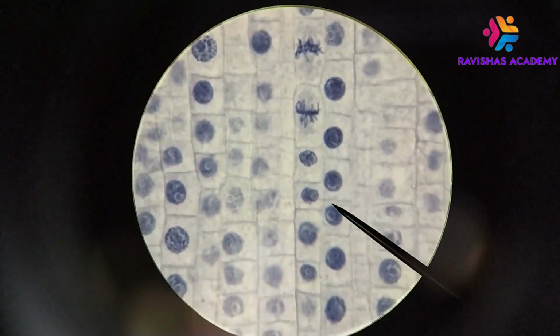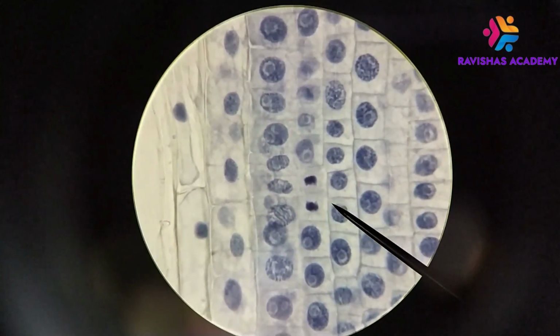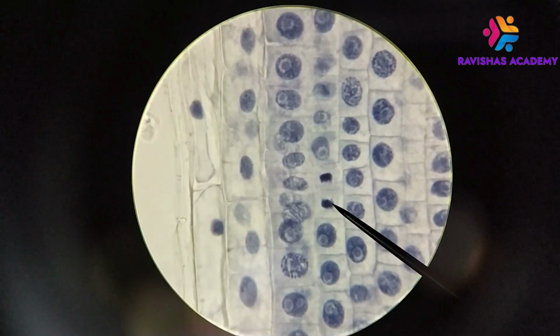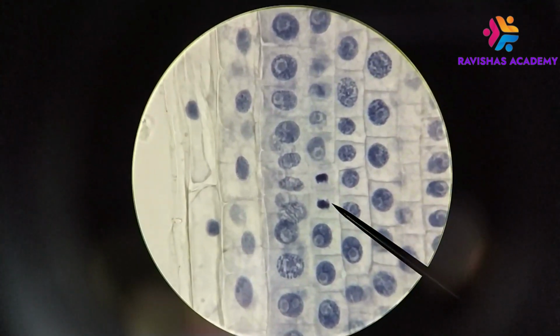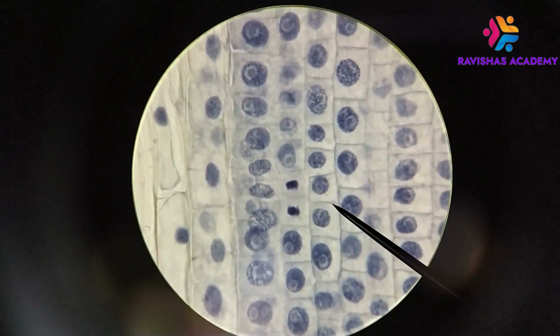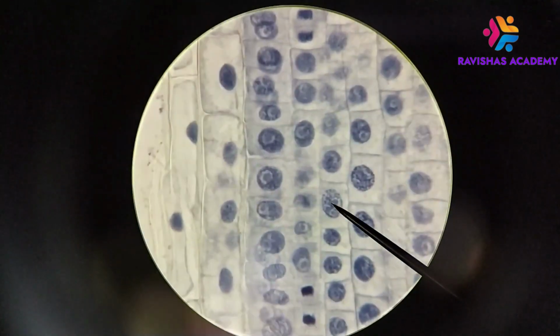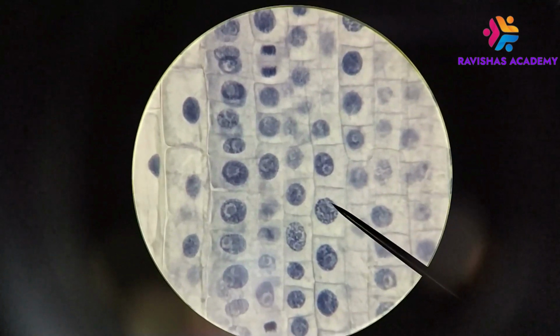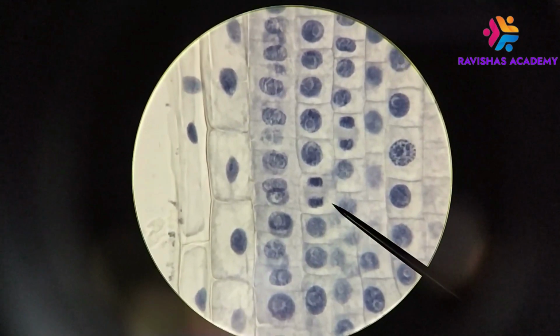One of the things that you'll notice is that as I scan around this slide, you see cells at different stages. So what we have here is a nucleus that's kind of above the others, so it's overlapping some of the other cells. We have more than one cell layer in this case. This one's at prophase. This one here, we're looking at telophase. And again, lots more prophase up here. And up here as well, more prophase. Again, more telophase up here.